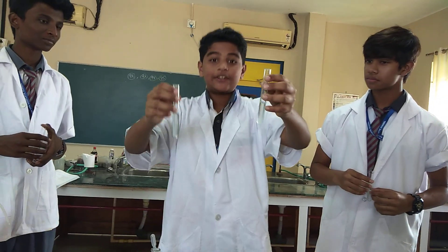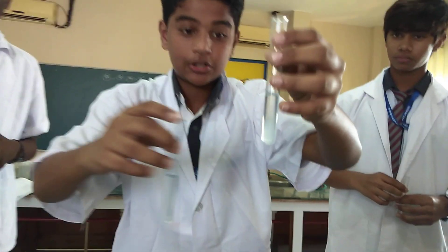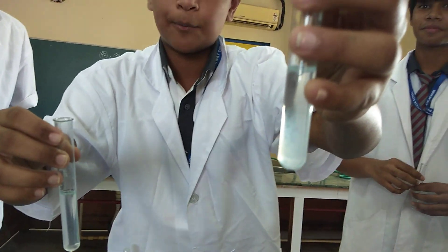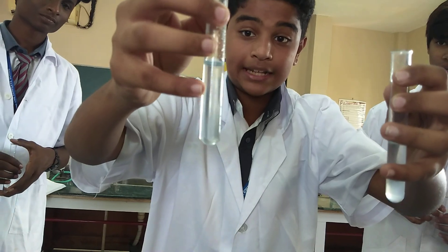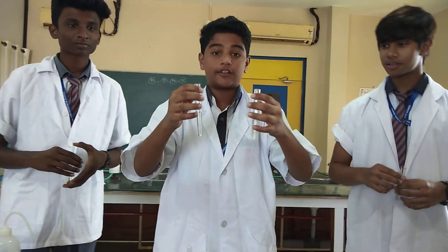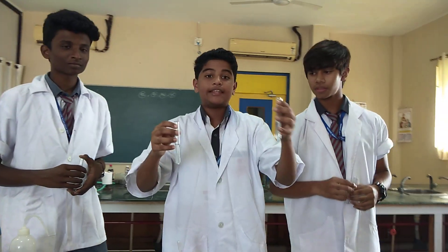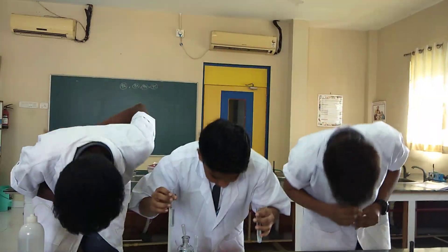So as you can see, in the aluminium solution you can see a precipitate remains in excess ammonia. But in the zinc solution the precipitate has dissolved. So this is the way we can see the difference between the zinc ions and the aluminium ions. Thank you.